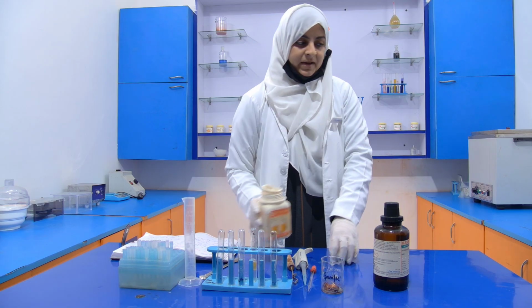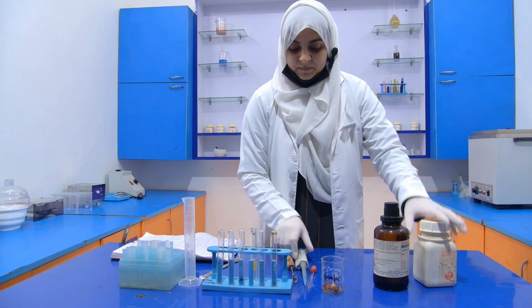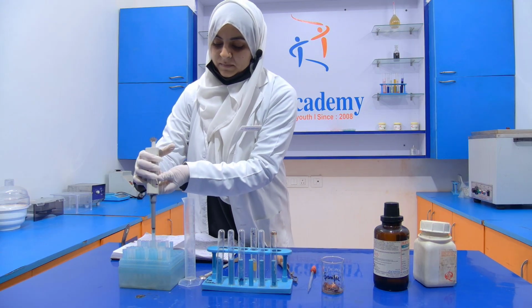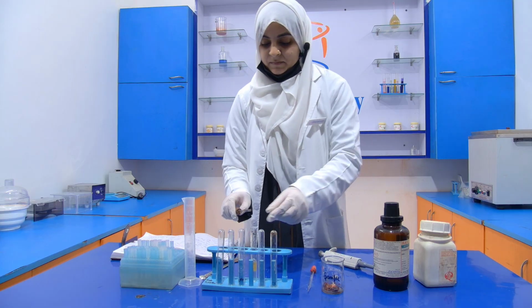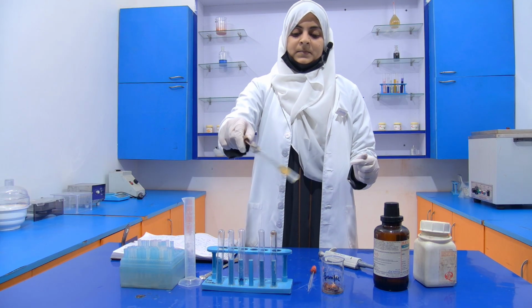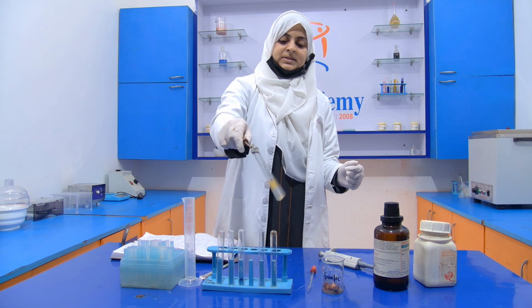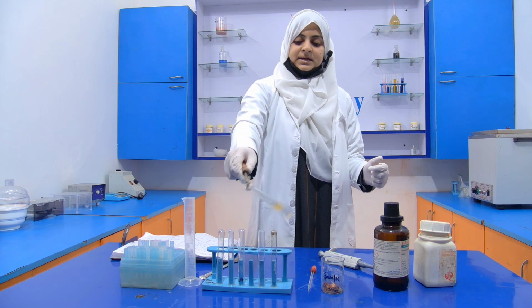Then after that, we mix it properly. When you are mixing it, you have to mix it far away from your skin.